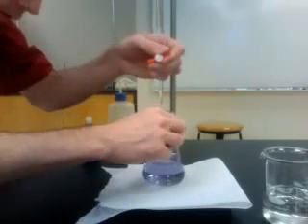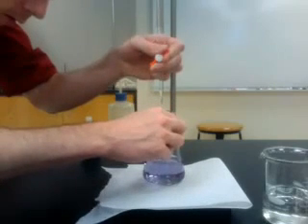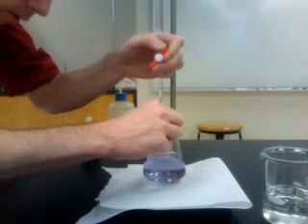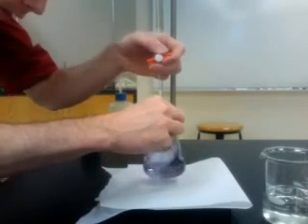You may wish to take a reading and add another drop and see if there is any significant change in color. As you can see here, there's no evident change, therefore the first drop that we'd added was the correct endpoint.